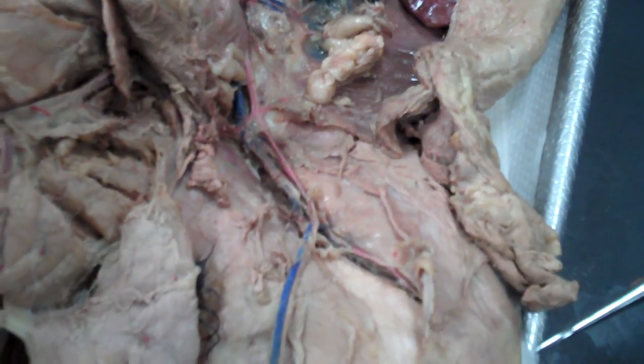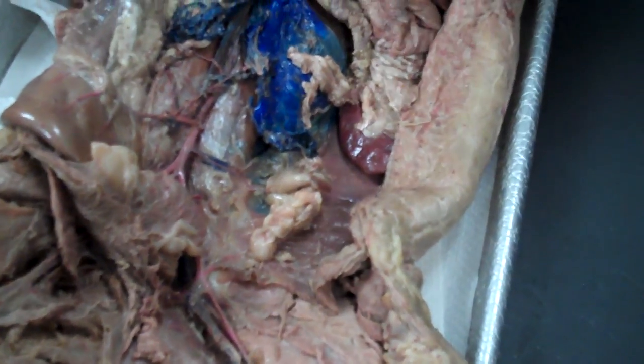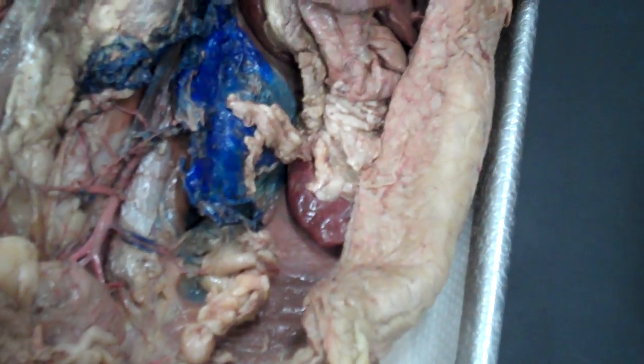Yeah? Okay. And is there a cat like that has the, like the gastric and the splenic and the really like? Yes, there's the one over there. Okay. I haven't really seen that like.